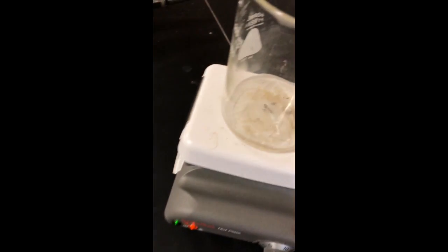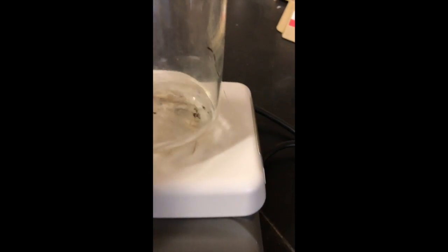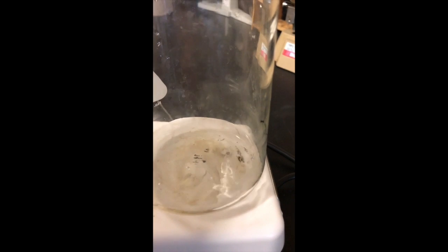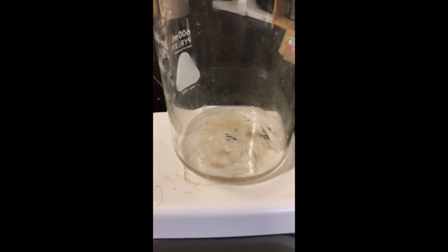Now in section number 2, lab number 2, it says crushed ice, beaker, and a warming plate. You're to place a small amount of ice in a beaker, place the beaker on the hot plate, and see what happens. Okay, so they had placed ice in here. They heated it up. You can see that there's still a little bit of ice in there. Is that a chemical or physical change?